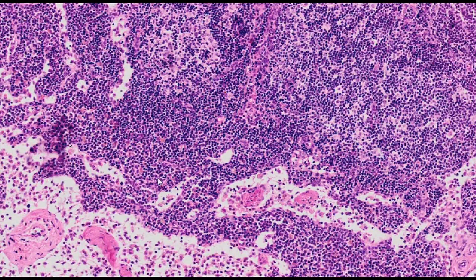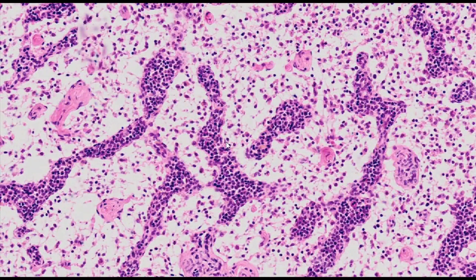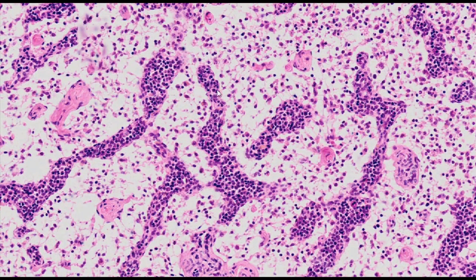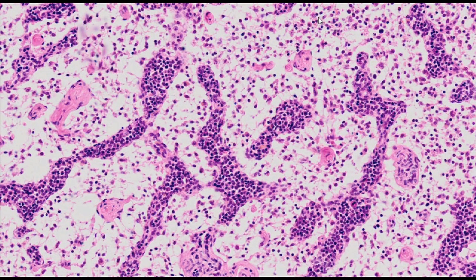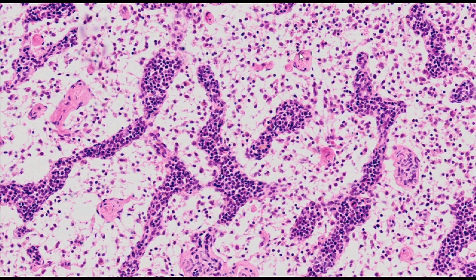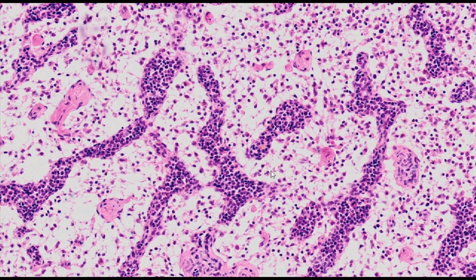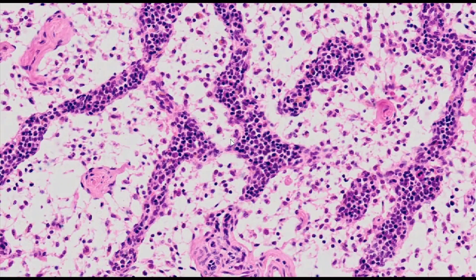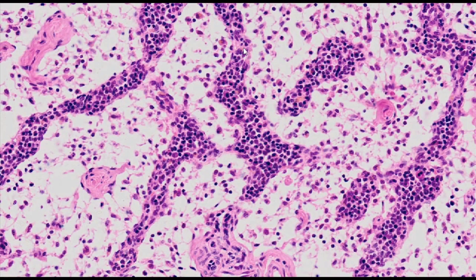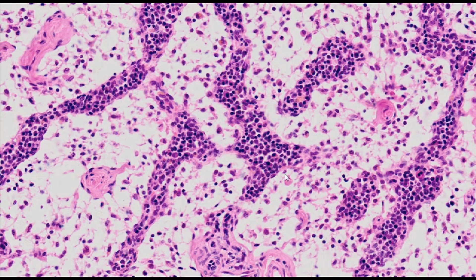The following structures can be observed in the area of the lymph node core: intensely stained medullary cords, wide medullary sinuses, and connective tissue trabeculae. Medullary cords are rich in cells, including B cells, plasma cells, macrophages, and dendritic cells.